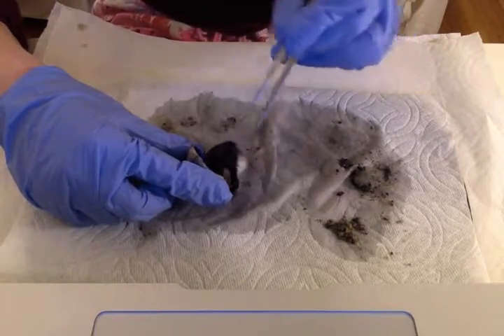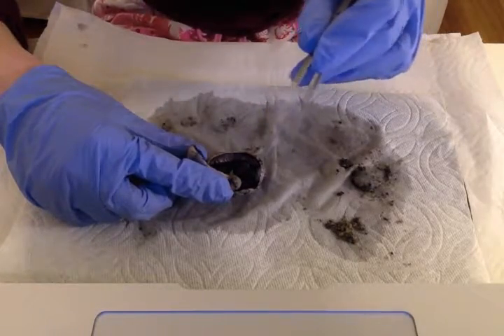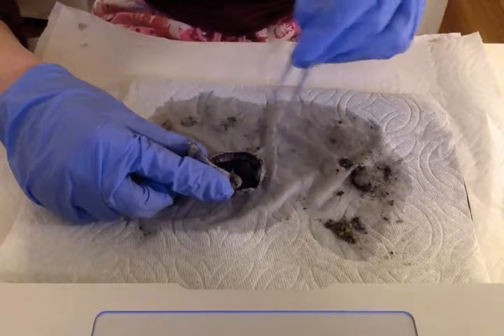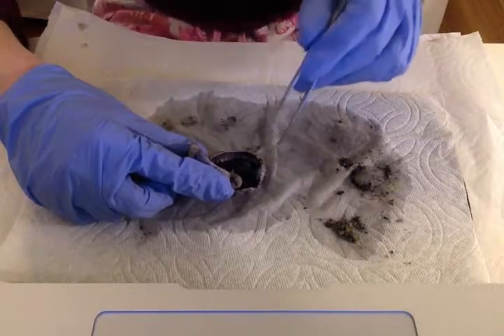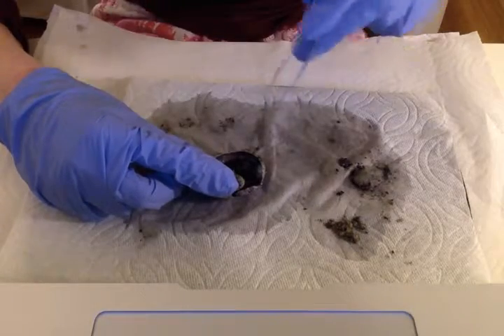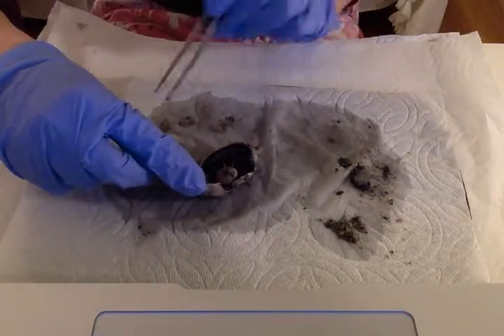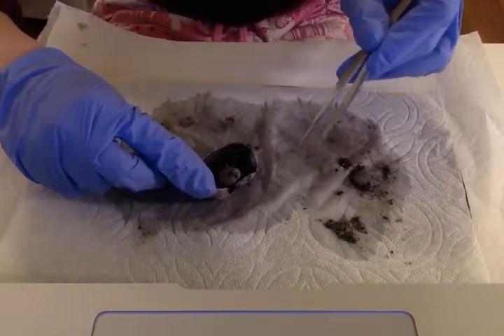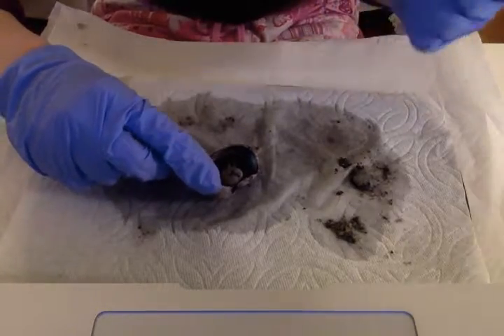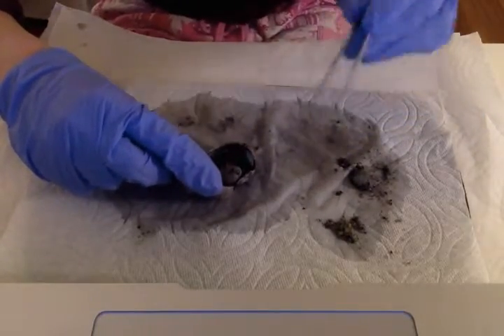Now the anterior chamber, which I cut into at the beginning of the experiment, is a fluid-filled space between the cornea and the lens. It includes the iris, and the fluid it's filled with is called the aqueous humor. The aqueous humor is secreted by ciliary epithelia that support the lens. You can see this paper towel, this huge wet mark. That's actually the aqueous humor that ran out as I cut into the anterior chamber. It's a watery, plasma-like fluid. It was pretty gross, I won't lie, to cut into.